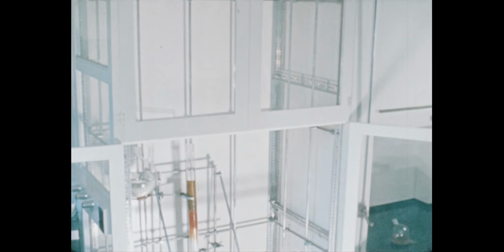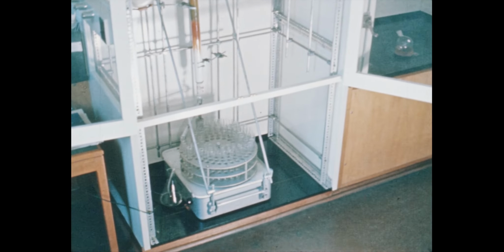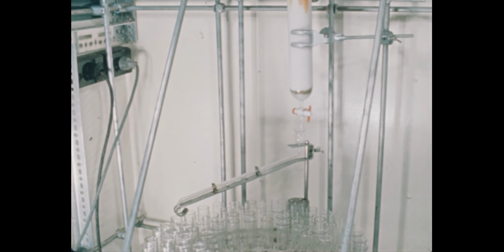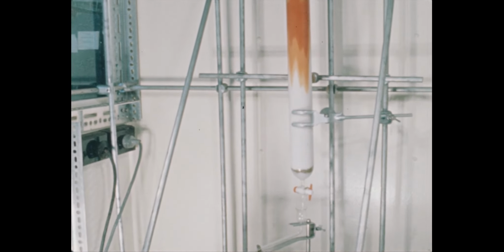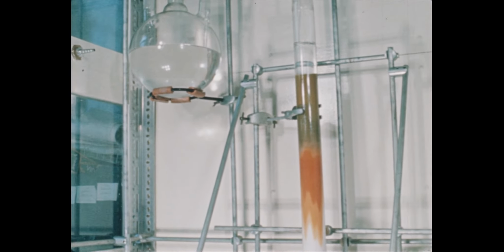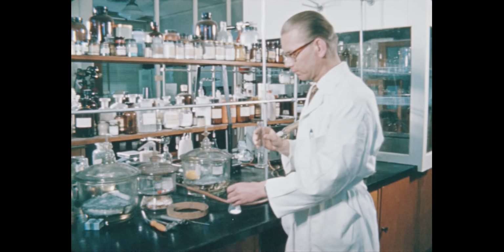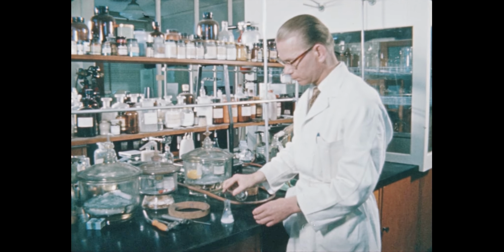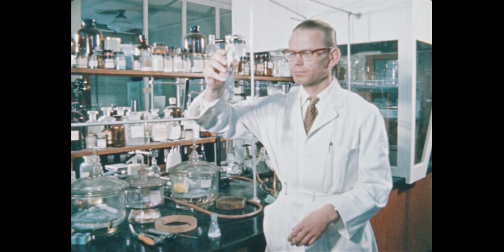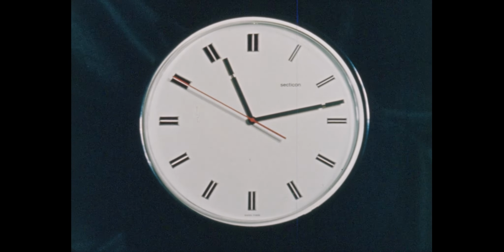A well-designed fume cupboard, kept in good working order and clean condition, is your best safety aid. Vapors are drawn out into the open air where they can do no harm. Why are the vapors dangerous? When inhaled, benzene can attack the body's blood cell production centers, injuring the bone marrow. Repeated exposure can lead to aplastic anemia and leukemia with fatal results.